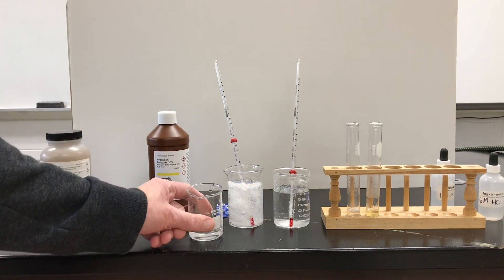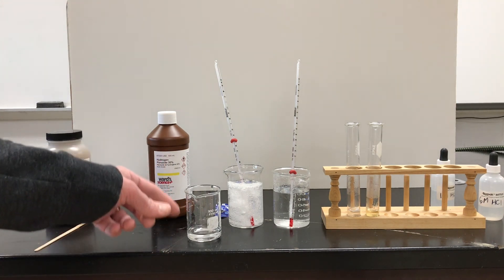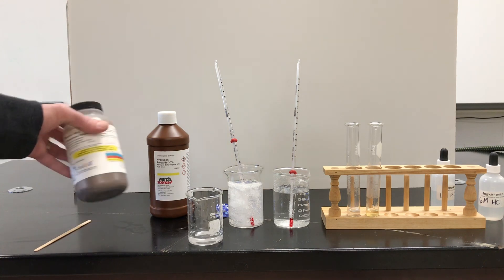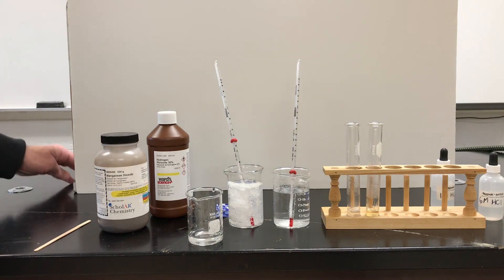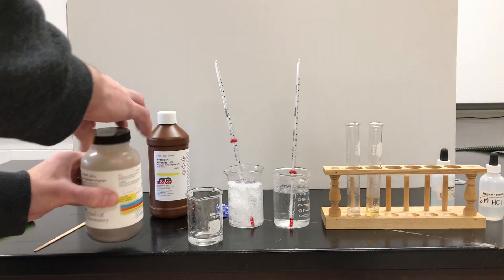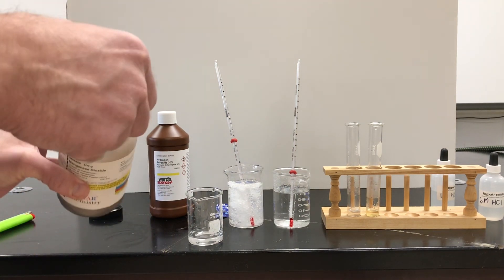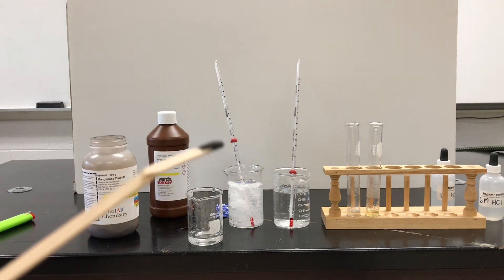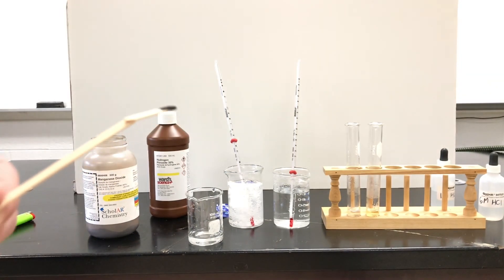Now that this is in sunlight, it could theoretically break down more quickly, but it would still take several days for that hydrogen peroxide to release that extra oxygen and just become water. But if I add a catalyst — something like manganese dioxide — it's going to help that hydrogen peroxide decompose and liberate that oxygen gas very quickly. So I'm going to take this wooden splint and put just a little bit of this black powder — that's your manganese dioxide, that's my catalyst — and put it into the beaker.